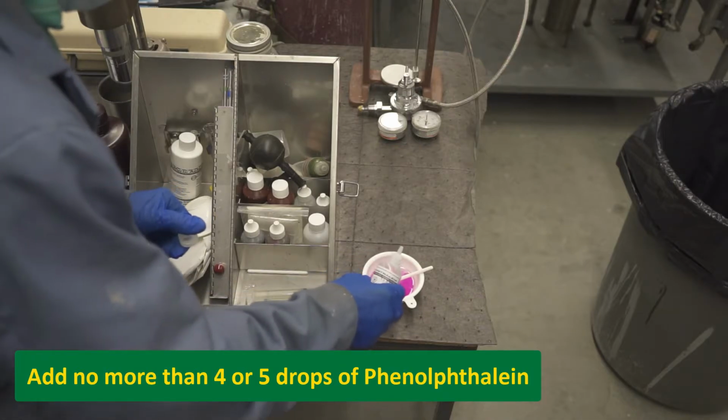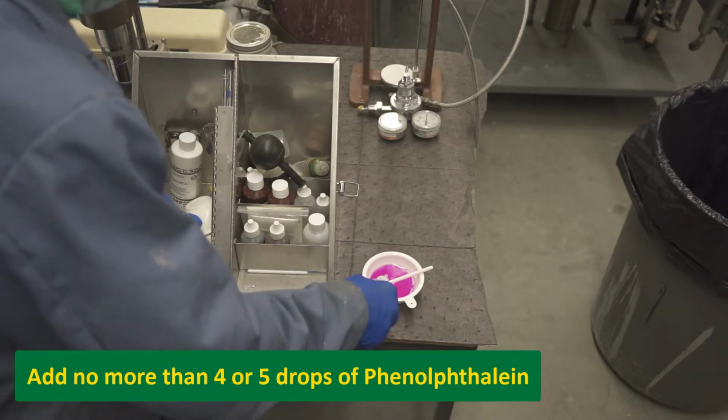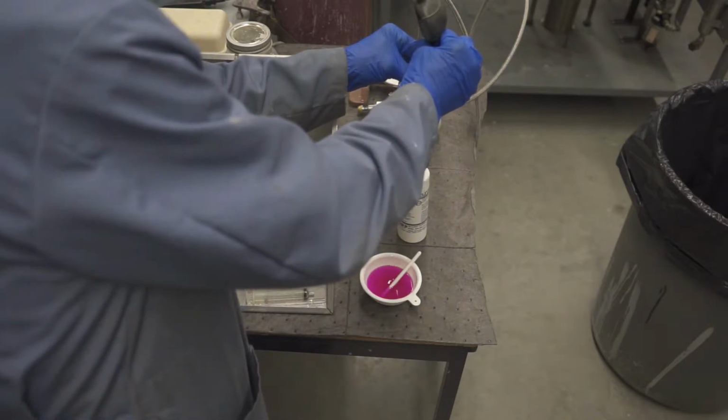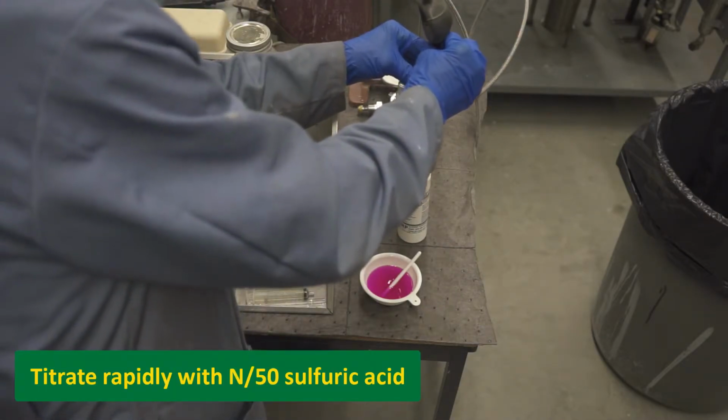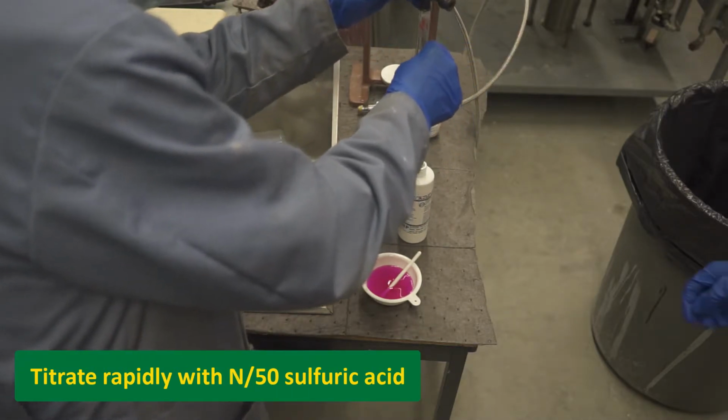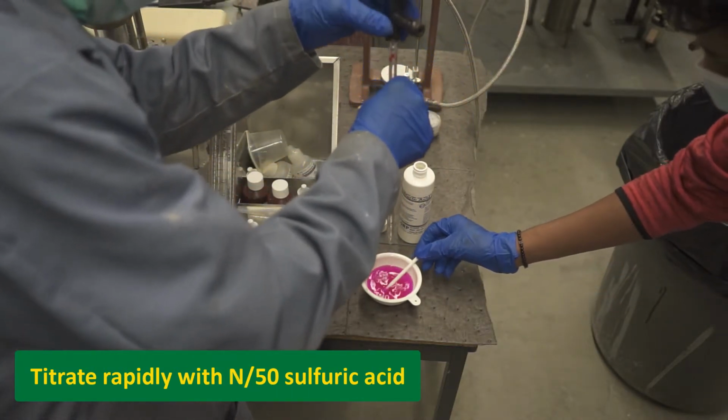If the sample does not change color, report PM as 0. If the sample turns pink, titrate rapidly with N/50 sulfuric acid until the pink color disappears.